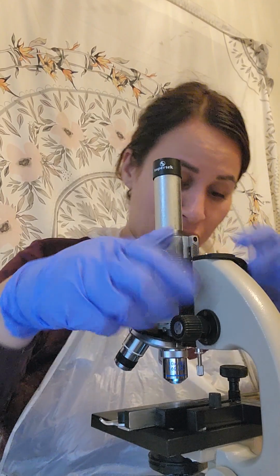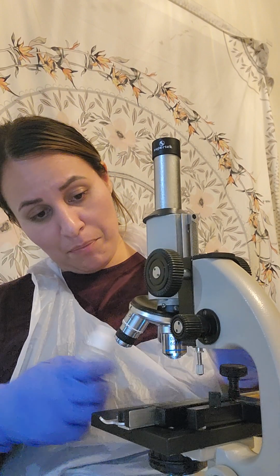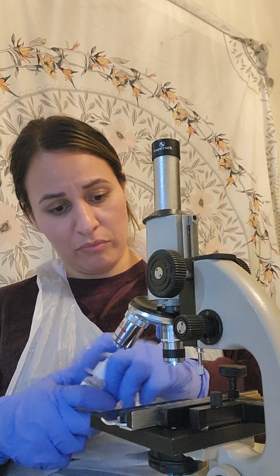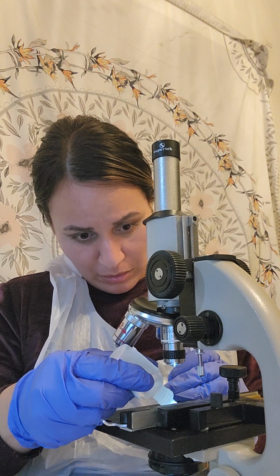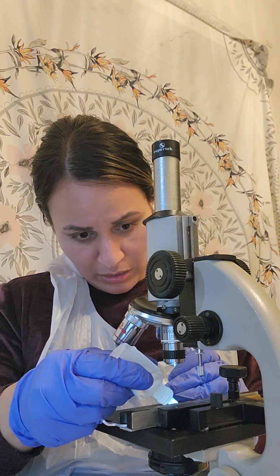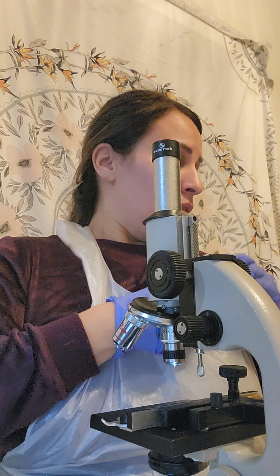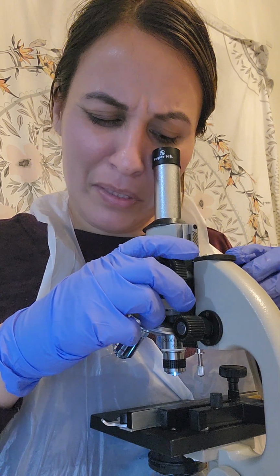If the light is shining through, I'm going to go ahead and put a drop of oil. Let me turn this really quickly, because that would be really bad if we got oil on any other magnification lens. So I'm dropping one drop of oil onto the letter E, and careful not to touch the slide with the top of this. Okay, so I'm going down.